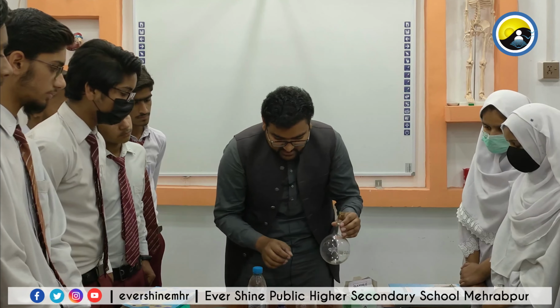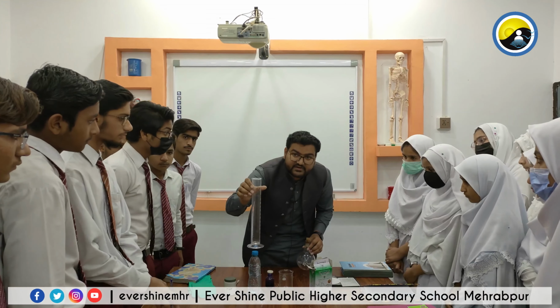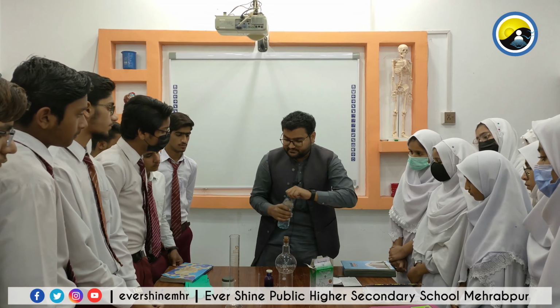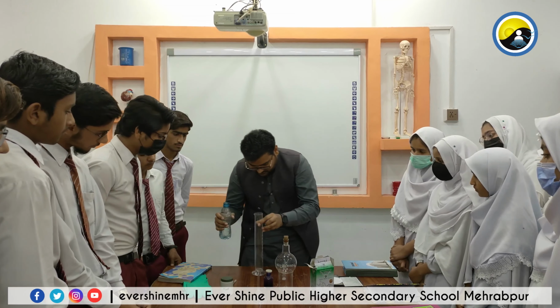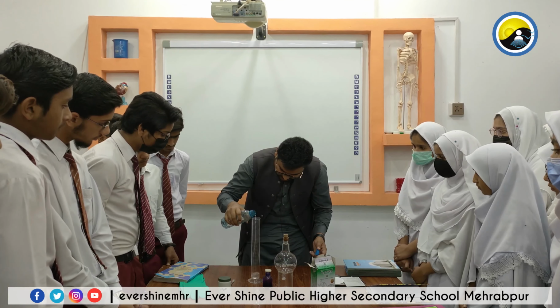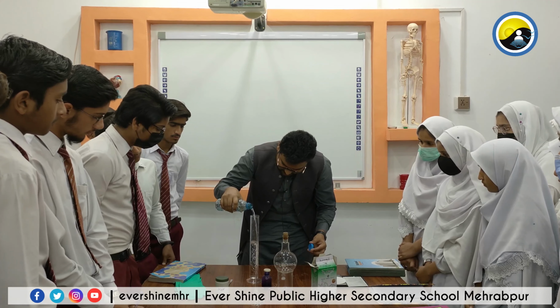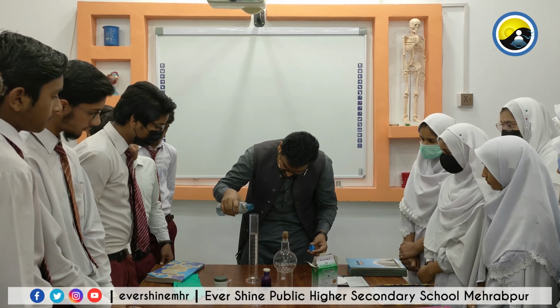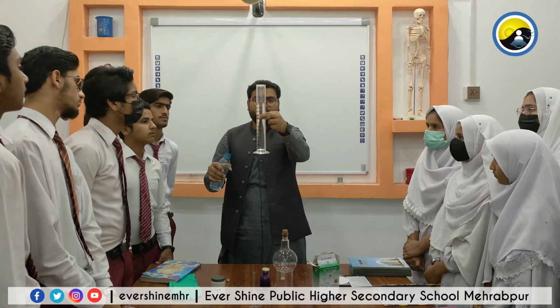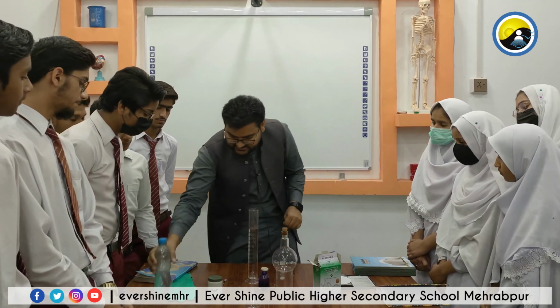To prepare this solution, we need 250 ml of water. So we have a measuring cylinder of 250 ml. We have to fill it with 250 ml of distilled water. Okay, now we have 250 ml of distilled water.